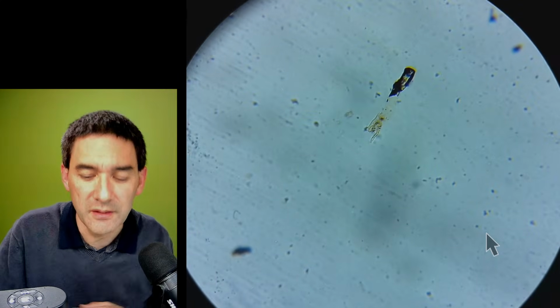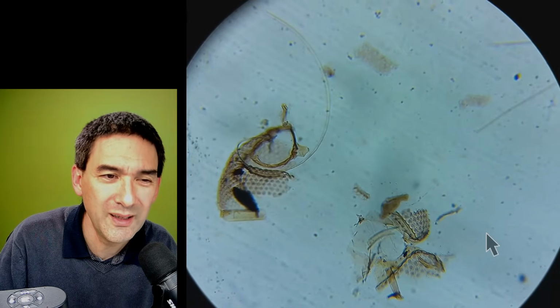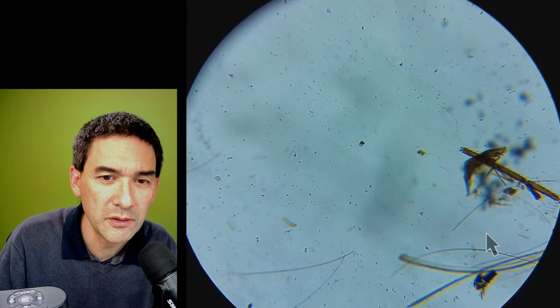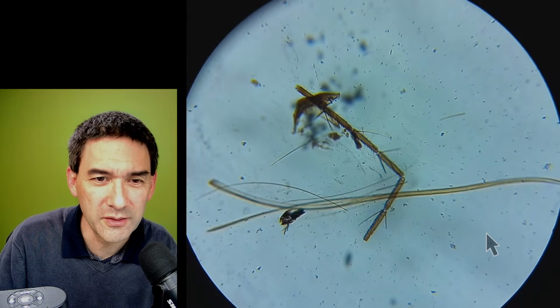No, this can't be it. Ah, here's some. Over here, maybe. It looks more like it.